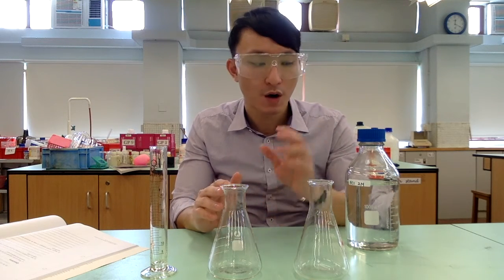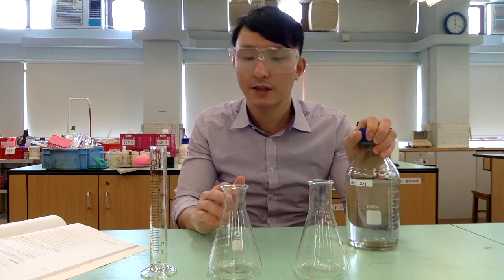Hi, in this video I'm going to show you experiment 37.5. We want to investigate the effect of surface area on the rate of reaction. So let's get started. First of all, we are going to measure 50 cm³ of 2M hydrochloric acid into each of these two conical flasks.